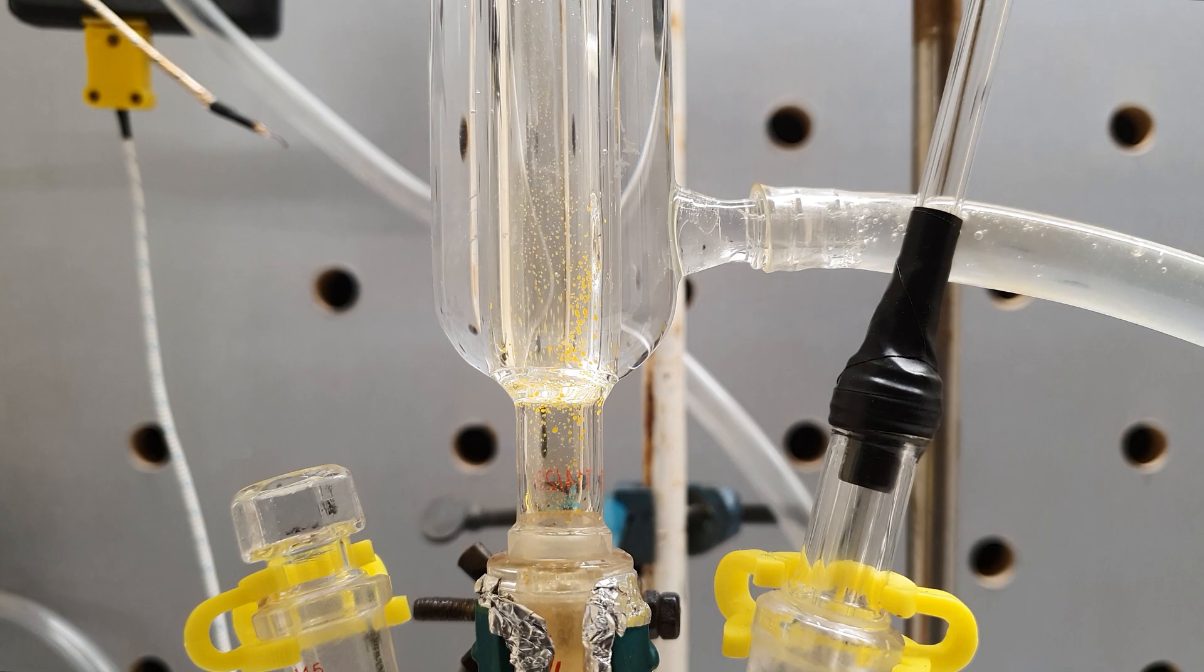The yellow stuff you see in the walls of the flask is iodine trichloride. It is the main product when the reaction is done in excess of chlorine, but small amounts inevitably form anyway.